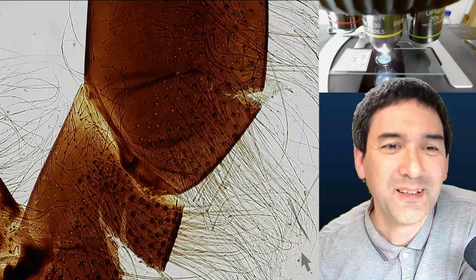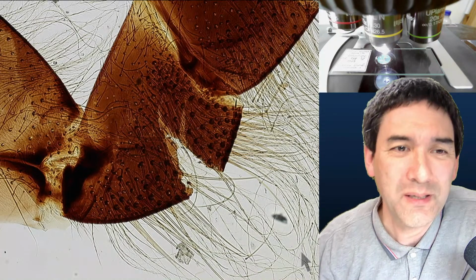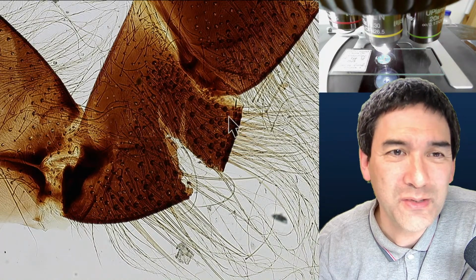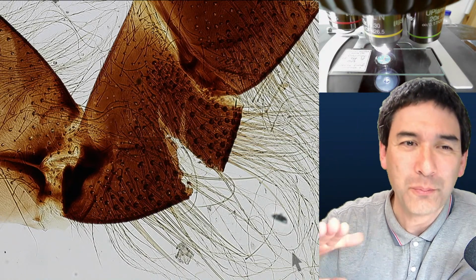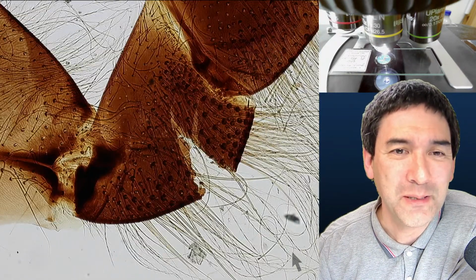But still, many of them are standard specimens. Look, this one unfortunately has been a little bit damaged during the preparation process. It's ripped a bit here. This is because, of course, the bee's leg has a certain thickness, and if you press it and compress it, this might damage the specimen a little bit.